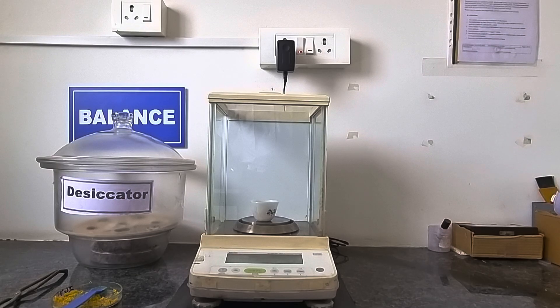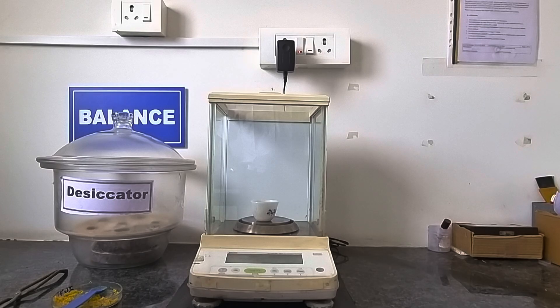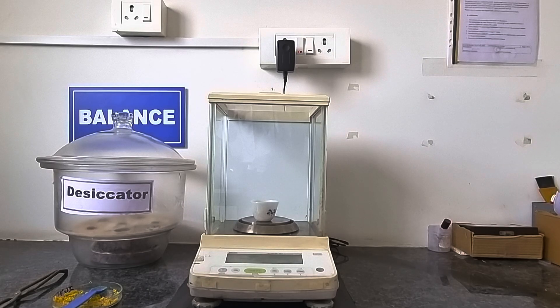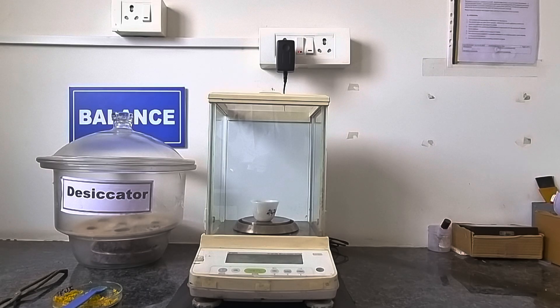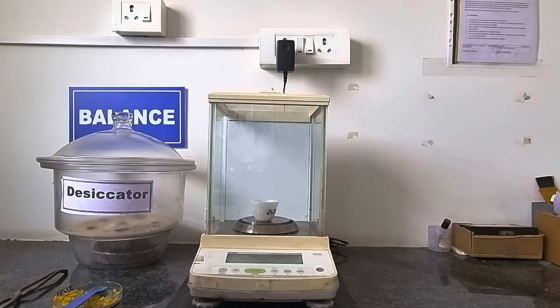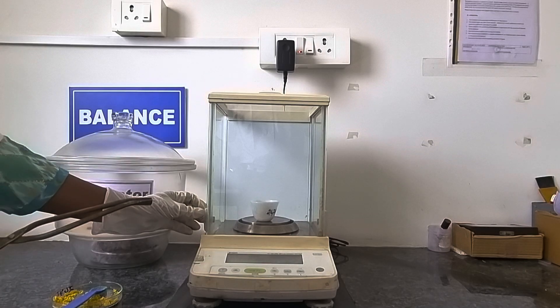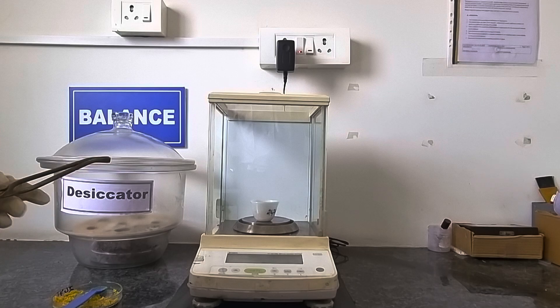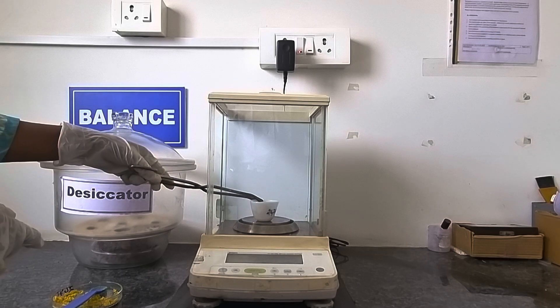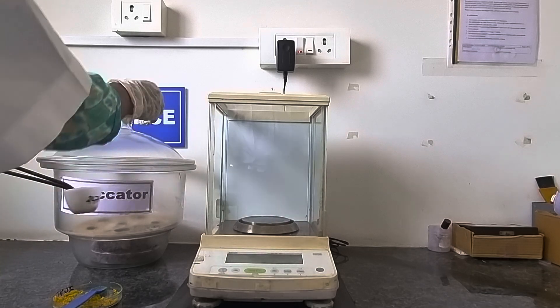This is the weight of sample along with the crucible. Now we will keep this crucible in the desiccator, and after that we will keep it in the furnace for ashing purpose.